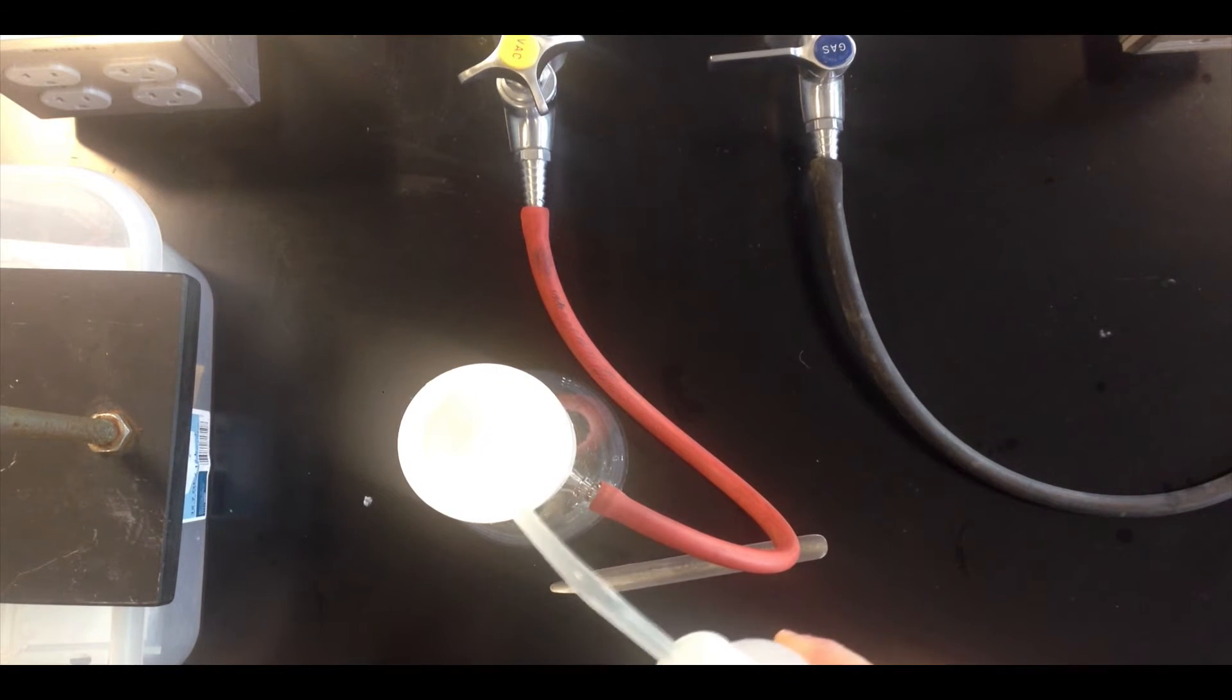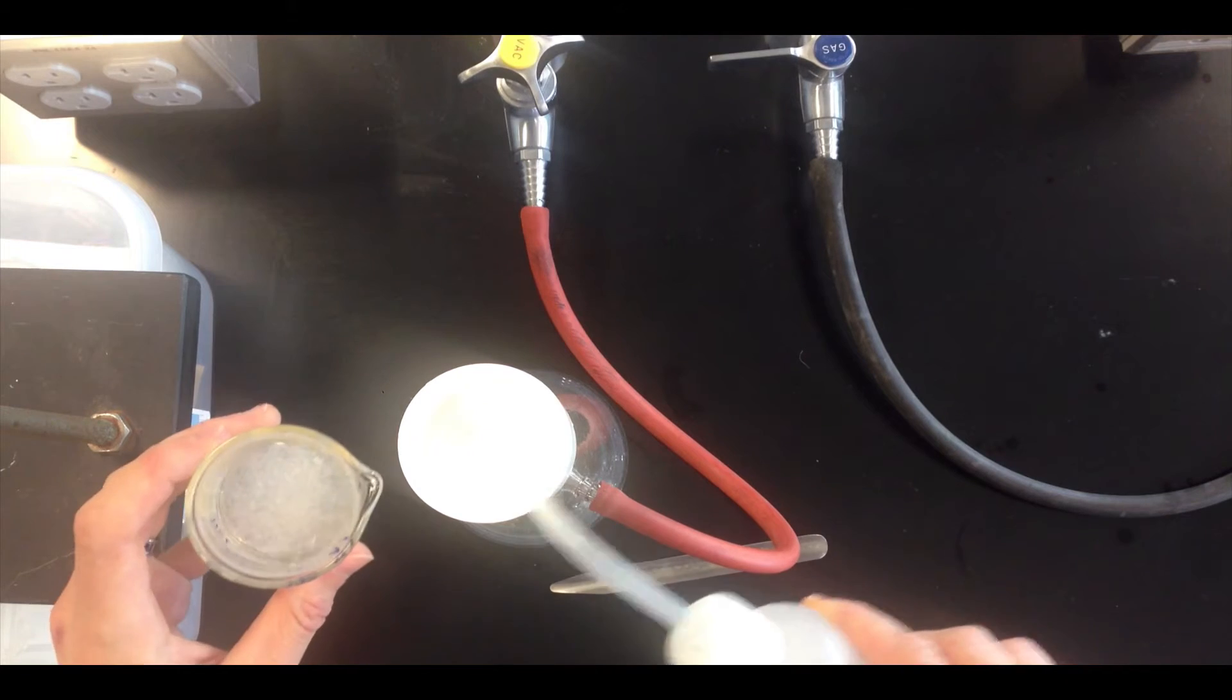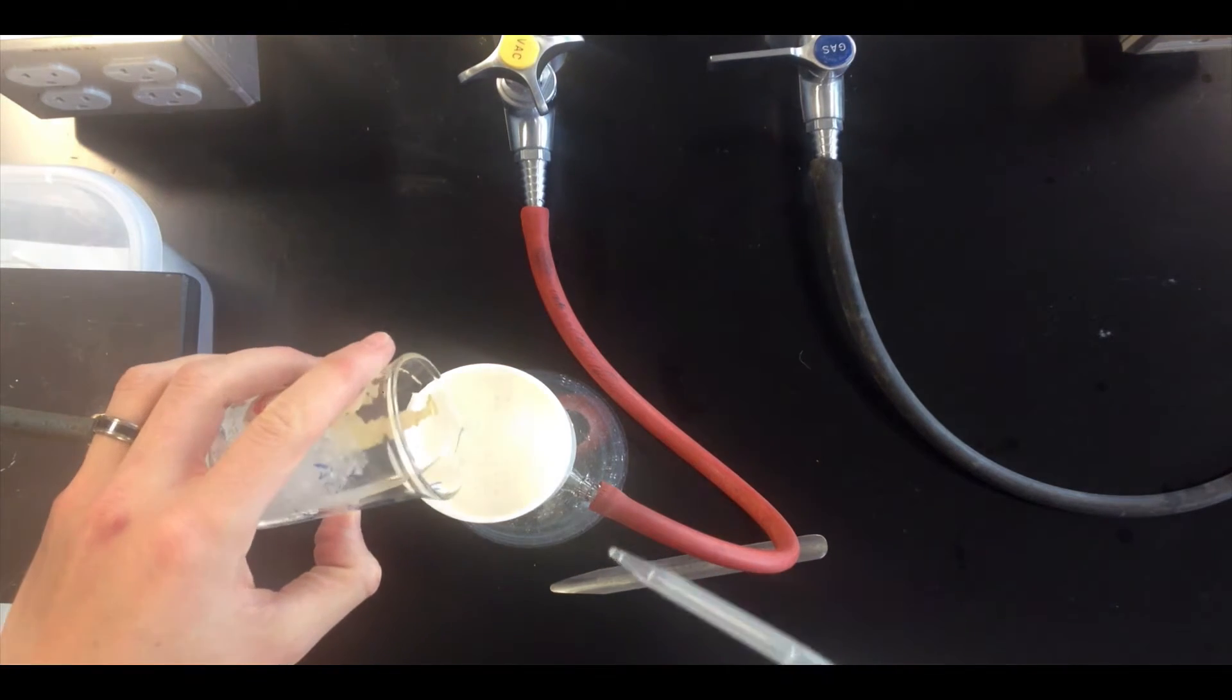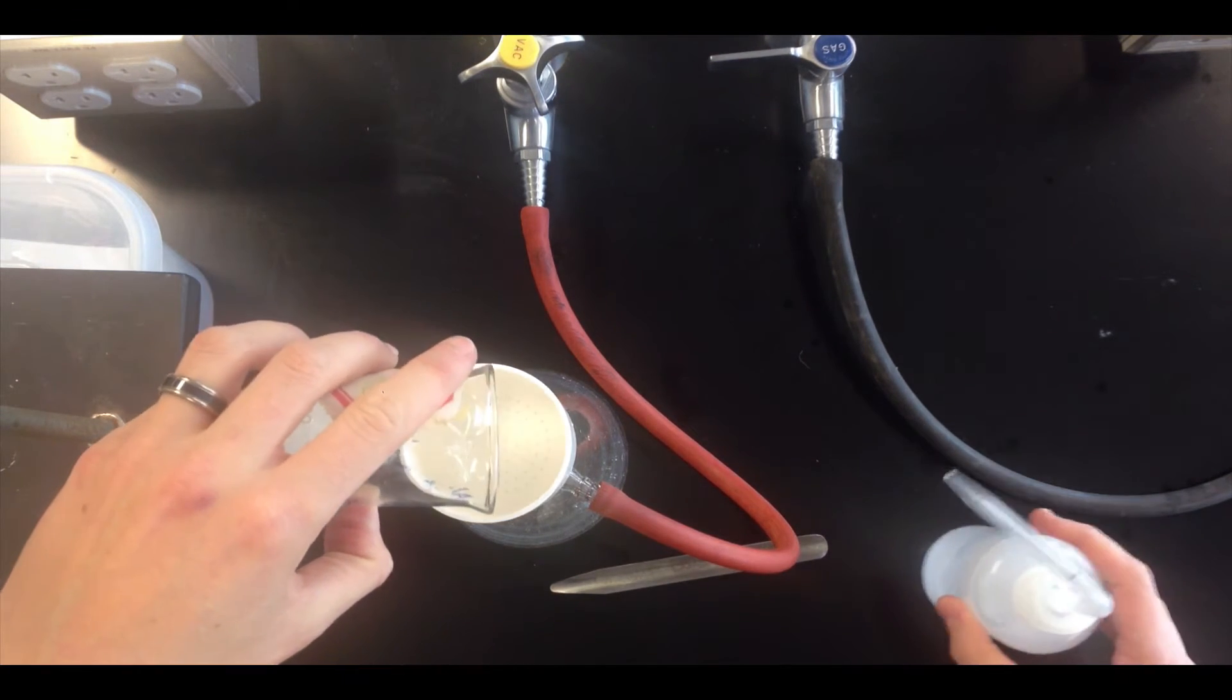So I'm going to go ahead and do that, and of course that water will be pulled through pretty quickly, so more or less right after I've wet the filter paper, I'm going to go ahead and start pouring the mixture on top.